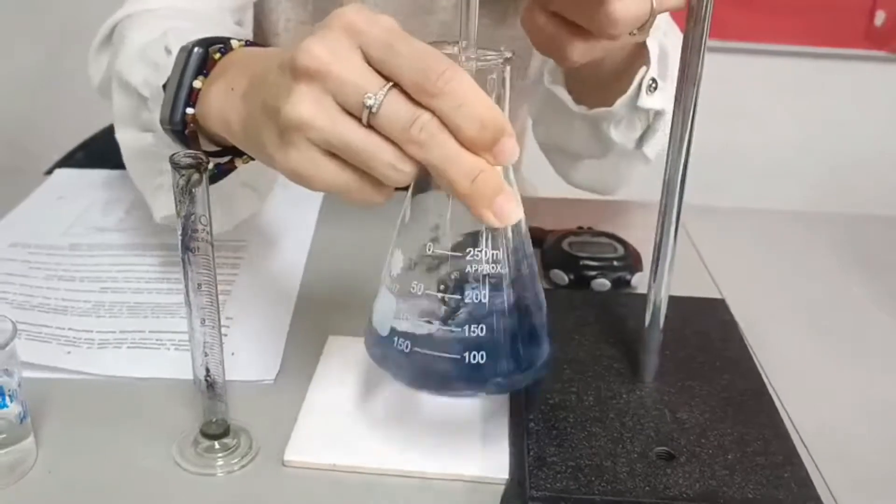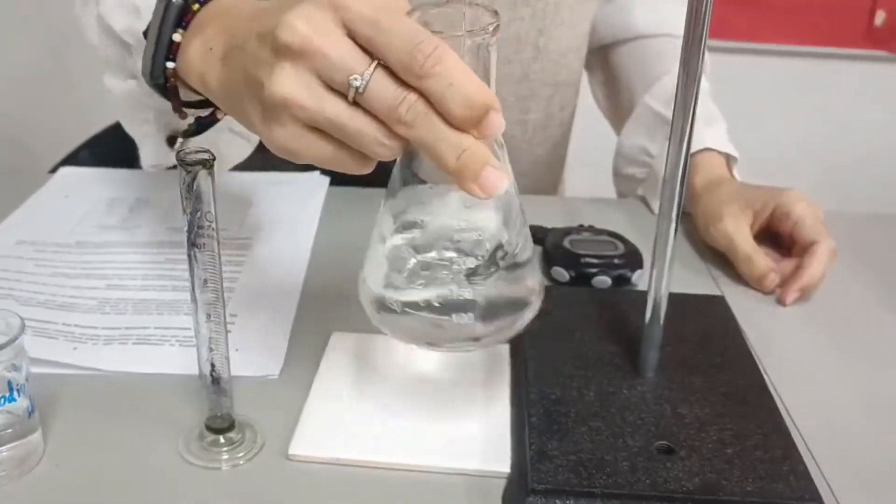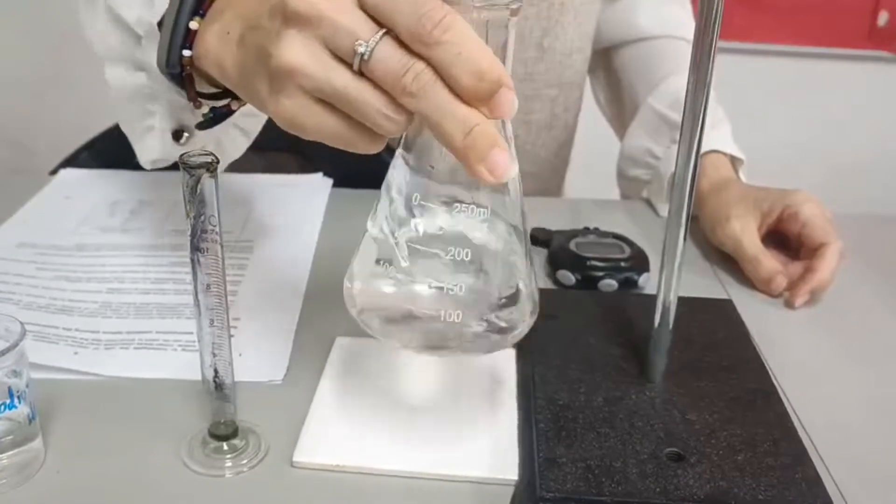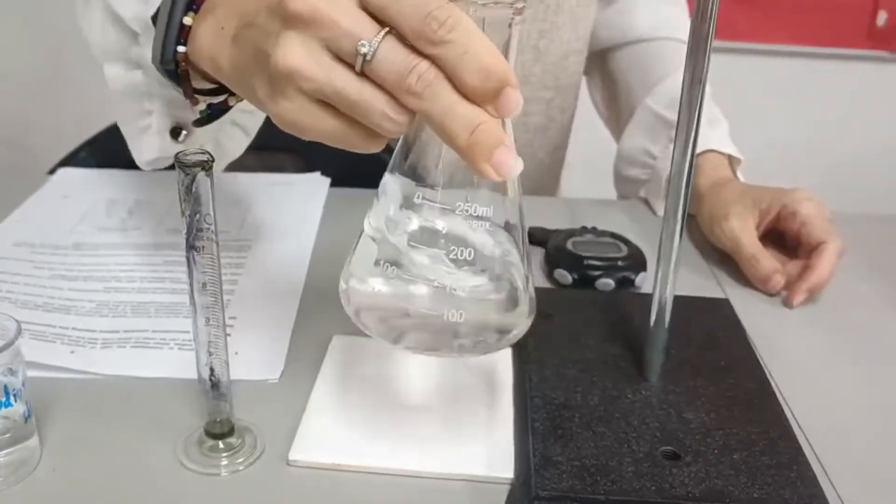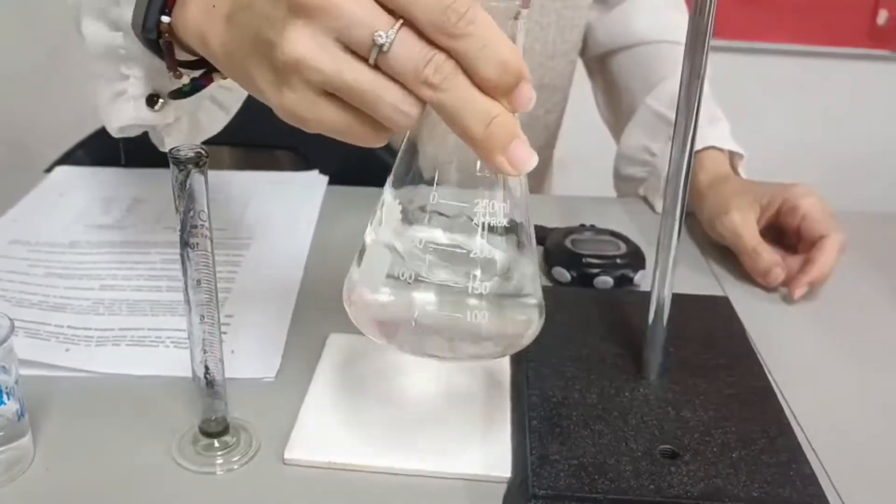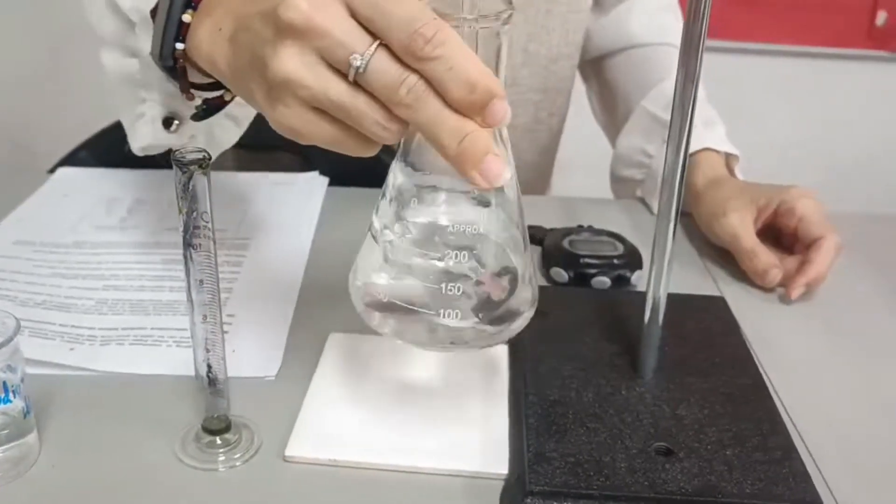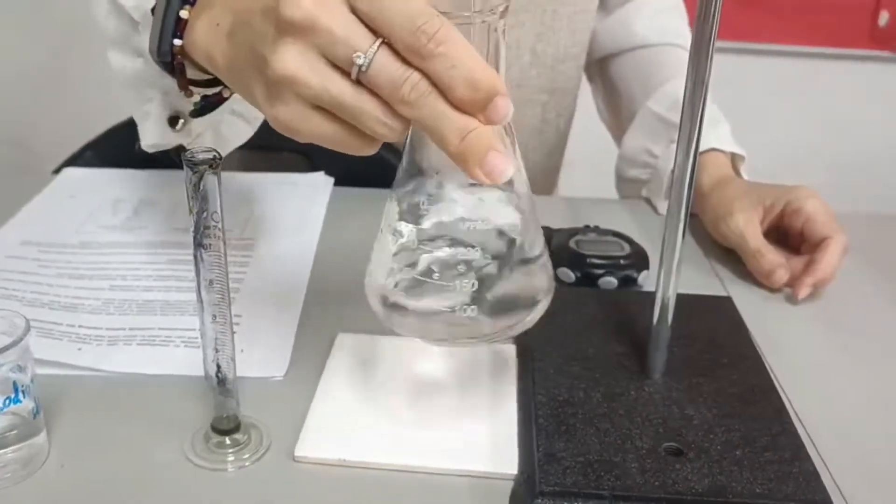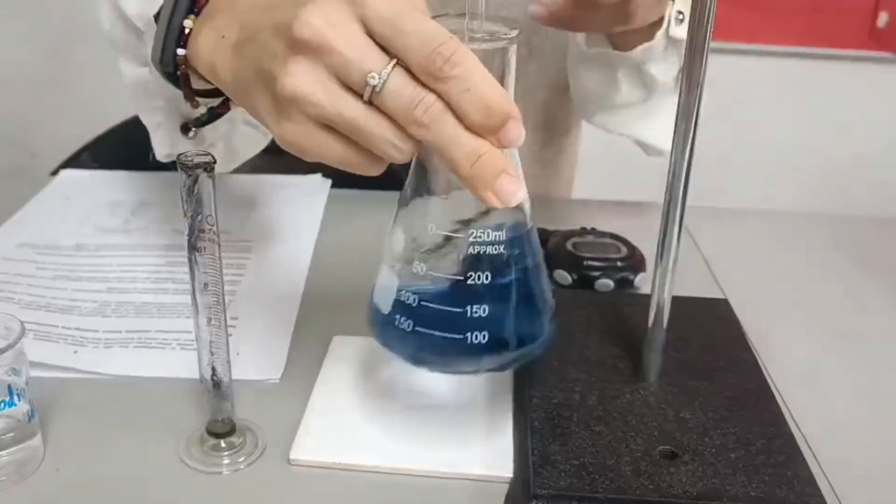Add a further 0.5 ml. And again, record the time when it turns blue.